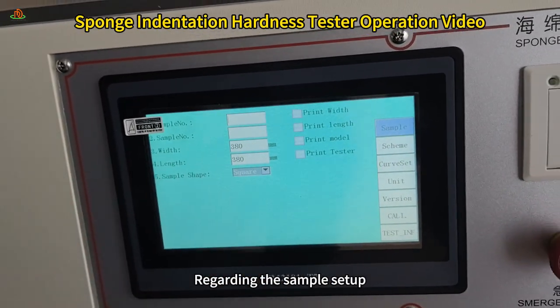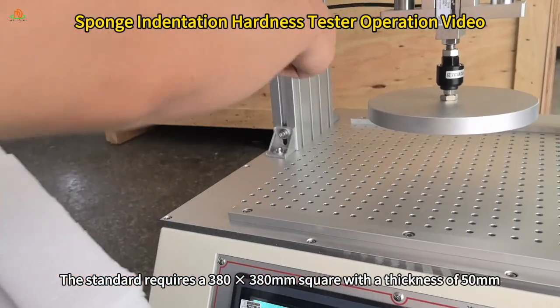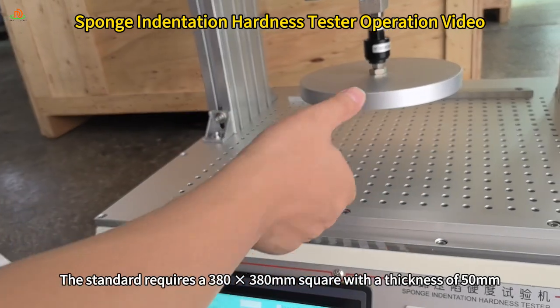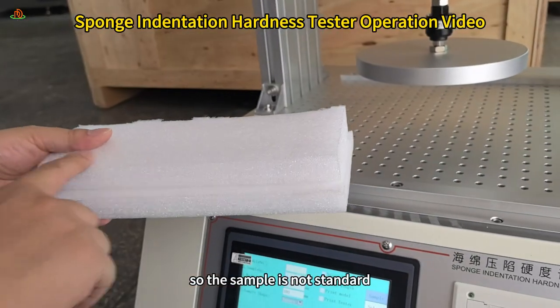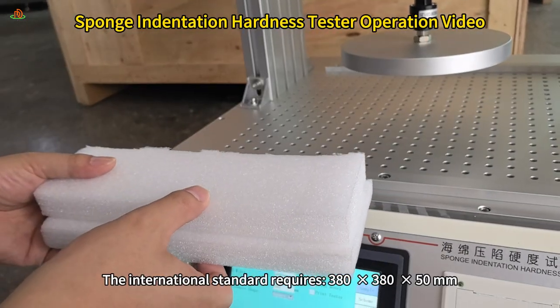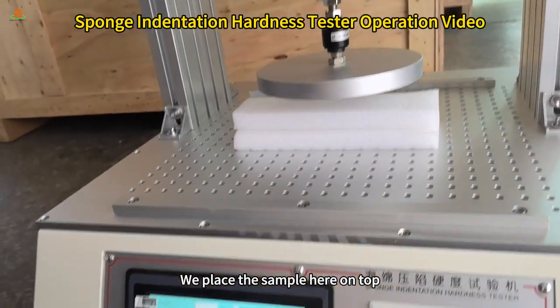Regarding the sample setup, we place a standard size sample here. The standard requires a 380 mm square with a thickness of 50 mm. We are only doing a demonstration right now, so the sample is not standard. The international standard requires 380 by 50 mm. We place the sample here on top.